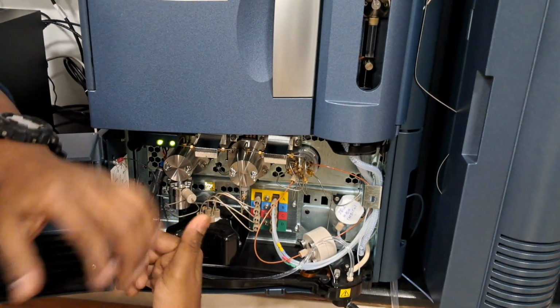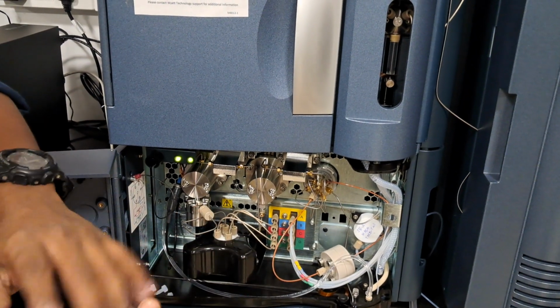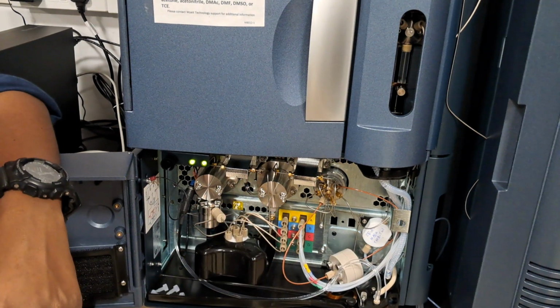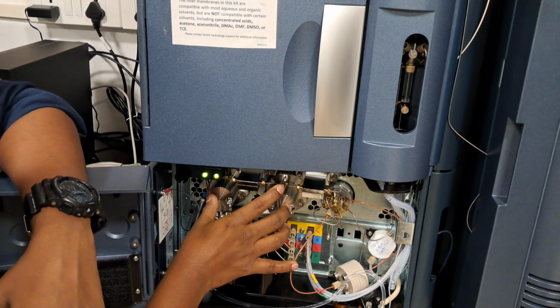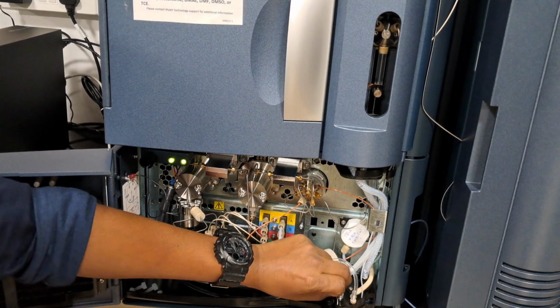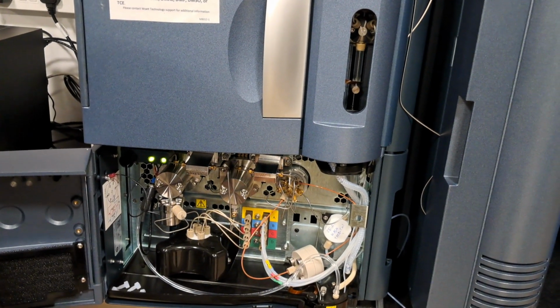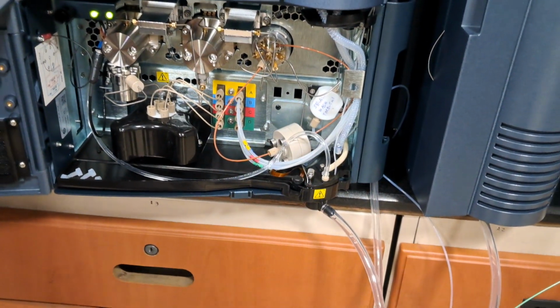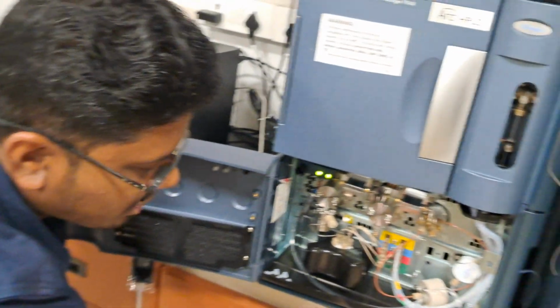Then this clicking sound is the front and back motion of the pump. So better to start with the seal wash first, irrespective of the solvent. Then it gets primed. The priming will be collected here. Just for your understanding, I am telling, so no need to open every time. Just see here, the flow is coming out fast already. If everyone tends to open it, it may break and get damaged.